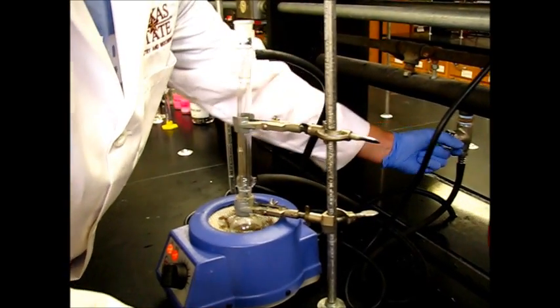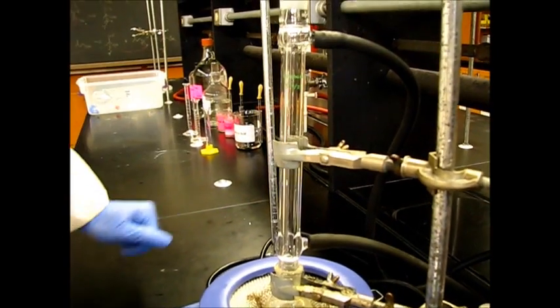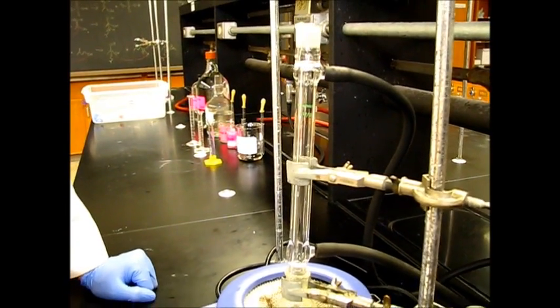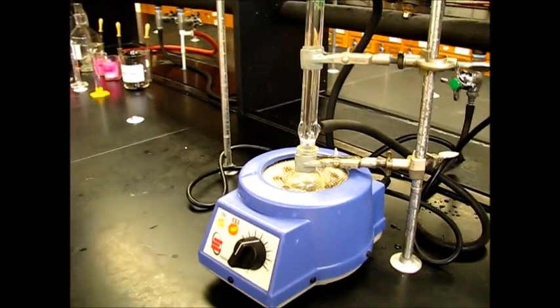So we'll go ahead and turn this on just barely. No, we'll go ahead and turn this up to like six and wait for it to boil. Once it starts boiling we'll start a timer for an hour and a half.